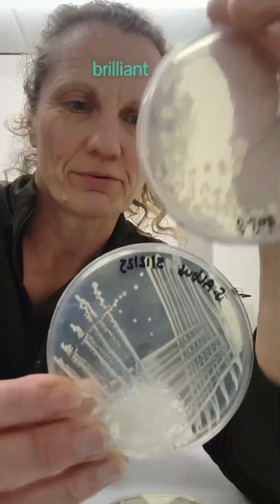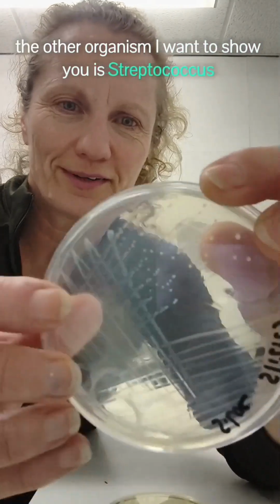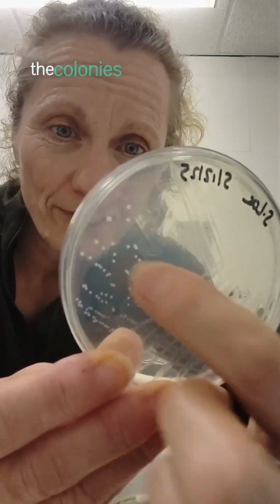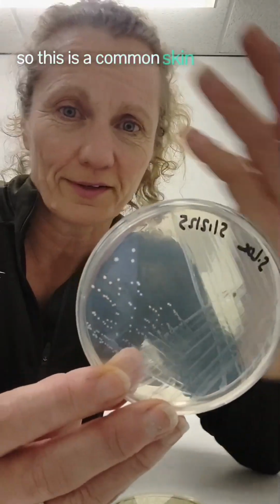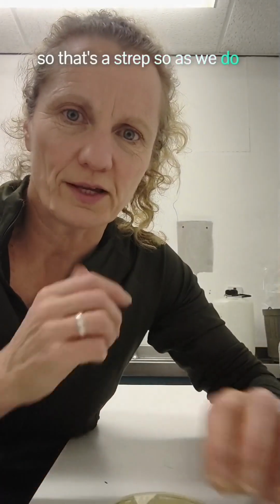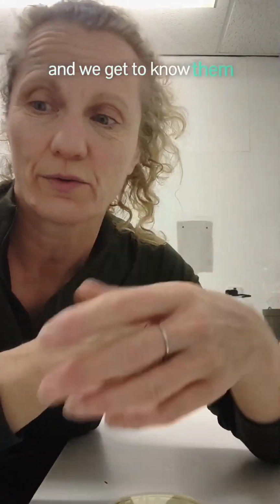Can you see? Brilliant. Okay, the other organism I want to show you is Streptococcus. This is a species called Streptococcus lactis. The colonies are tiny. They're pinpoint colonies. So this is a common skin flora, and you find it in your mouth as well. So that's a strep. So as we do microbiology, we start to learn the different colony morphologies of the bacterium. We get to know them.